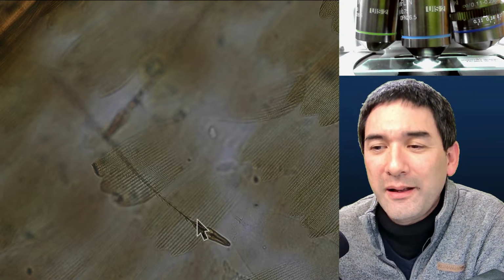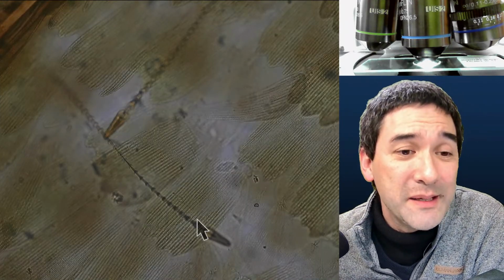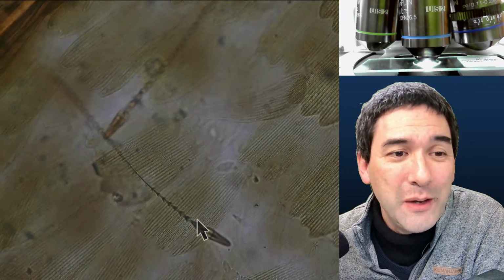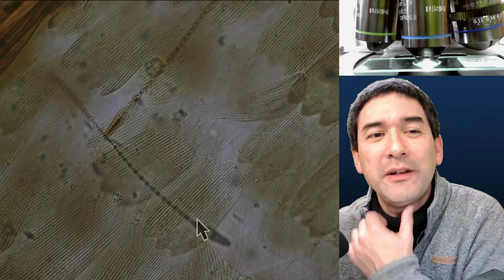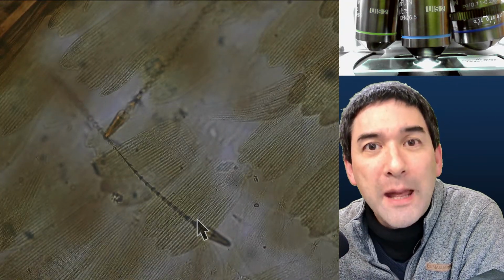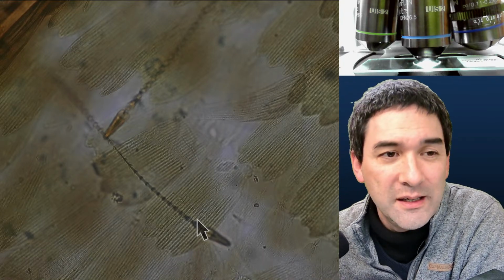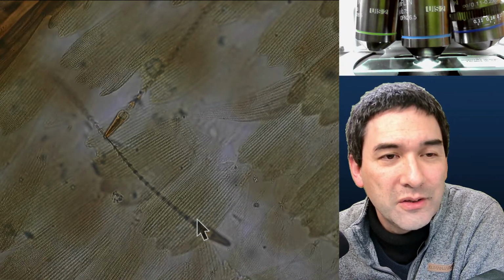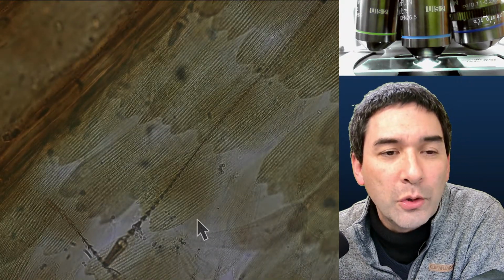Okay. I made some videos about this as well because I was really surprised. I would have never identified this myself, but I got a hint by some people. If you go into Google and type this in, they have a very nice term. If you speak German, then try to Google the term Pfeilhaare, arrow hair, if you were to translate this. Then you're going to find those here as well. So museum beetle or carpet beetle, it's called.